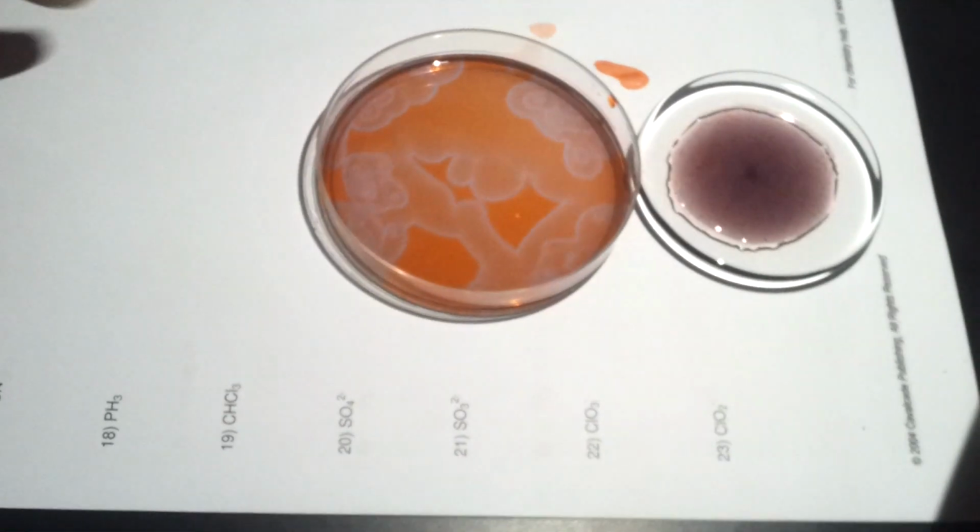Okay, let's get a close-up with that. Let's get that on the screen. And we'll take like the last 5 minutes of video of this thing. Someone videotape this part. I'm gonna put this on the website. Let's move that. This is the best one I've gotten to work actually. And it actually started out pretty slow. Yeah. All right, let's videotape. If you could videotape that for like the last 5 minutes.